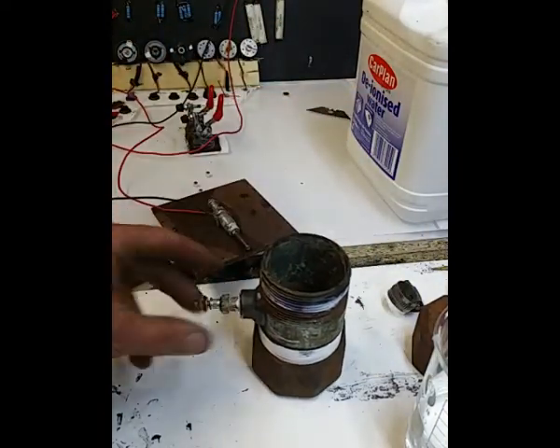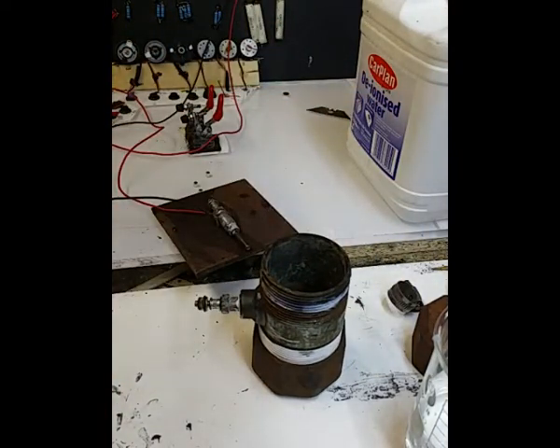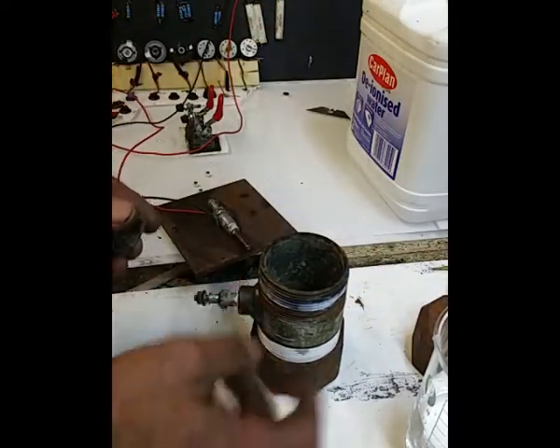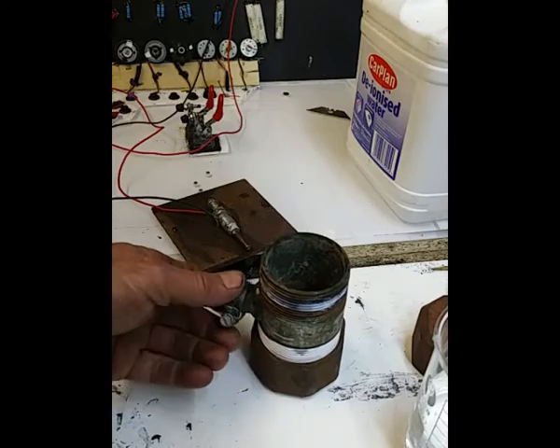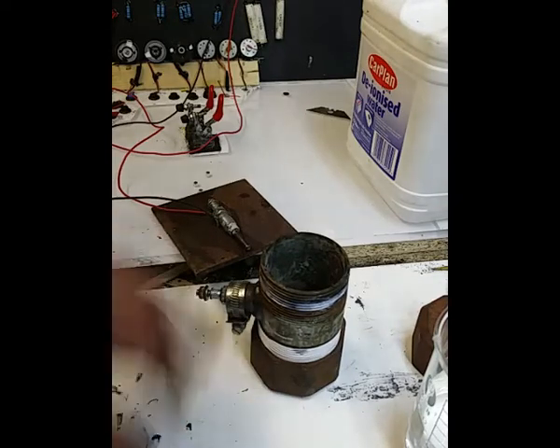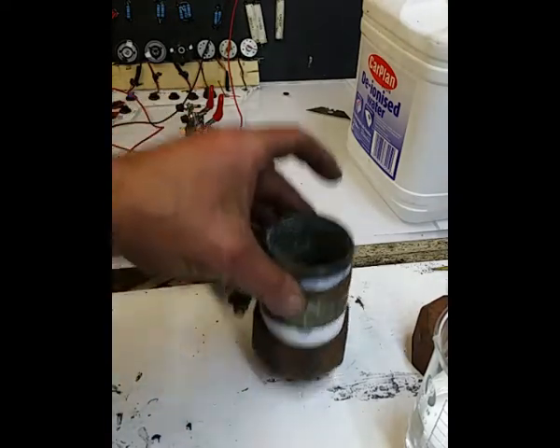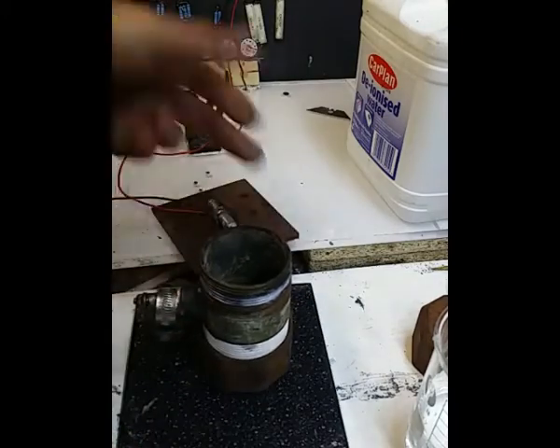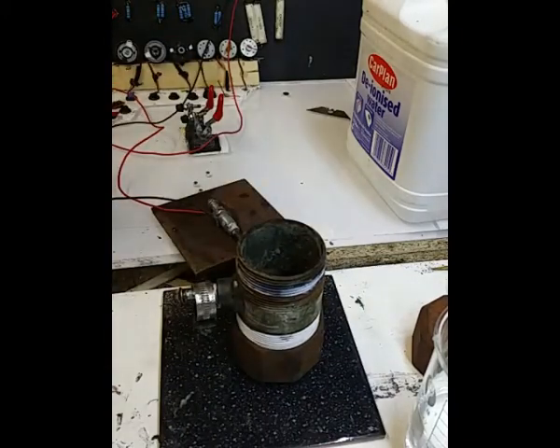What I'm going to do is wire this one up now, basically for the earth. The earth is the body of this, and I'm just going to use a Jubilee clip on there. That's it in a nutshell. I'll stand that on something, oh, there you go, look. An old tile, that will do, won't it? Fire it up on there, look, job done.